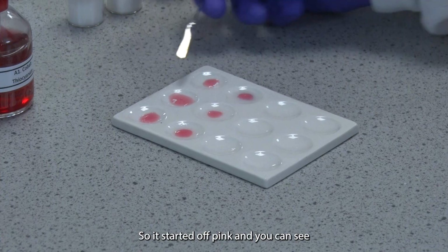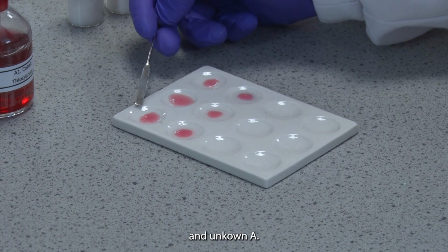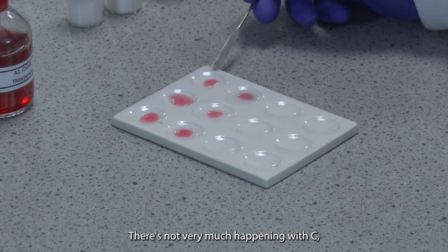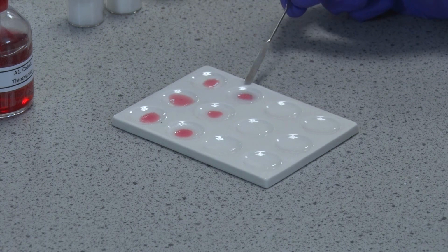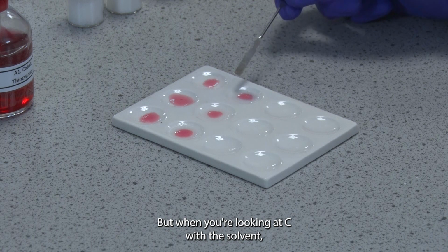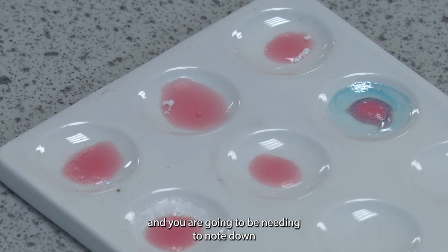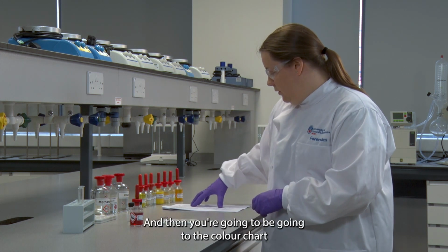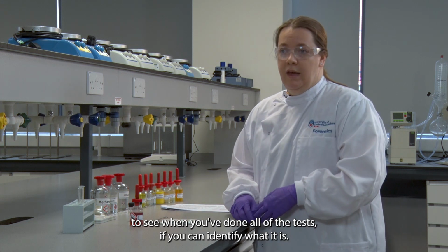So it started off pink, and you can see there's not much happening with reagent and unknown A. There's not very much happening with B. There's not very much happening with C. And it's the same for A and B when you're looking at the solvent. But when you're looking at C with the solvent, you're seeing it's changing colour. And you are going to be needing to note down all of those observations with the colour changes, and then you're going to be going to the colour chart to see when you've done all of the tests if you can identify what it is.